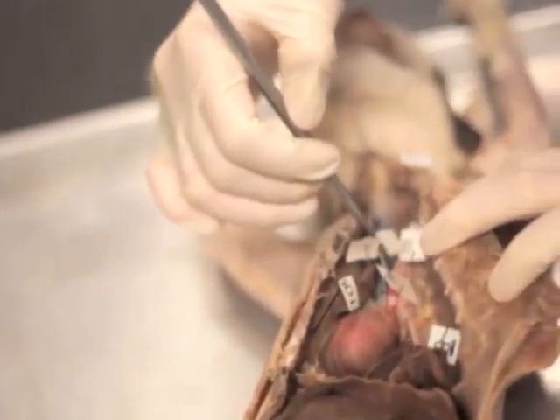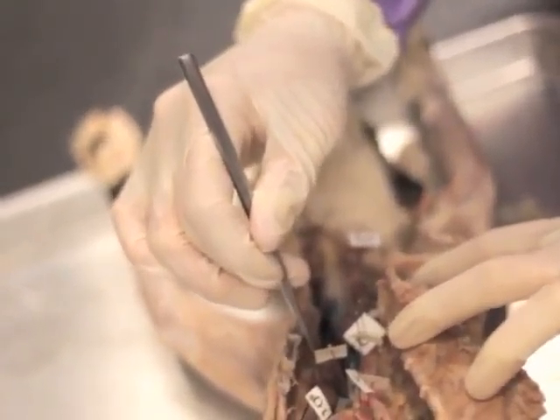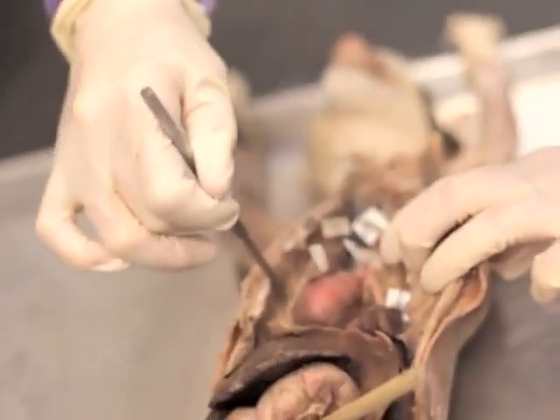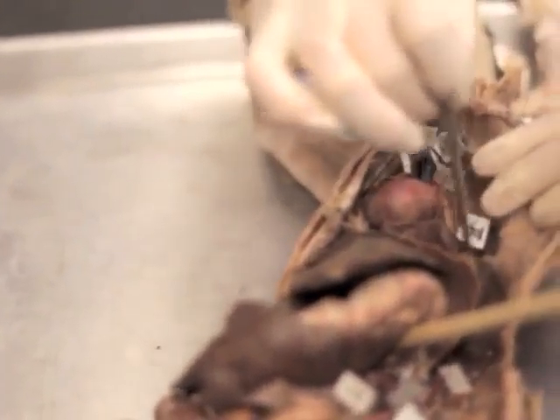So what are shown right here? Just 2? Yeah, we're looking at the brachiocephalic and then the subclavian, but not the other one. And then here you have the axillary, just before it branches, and then the brachial. Good. And then we have the intercostals, the descending aorta.